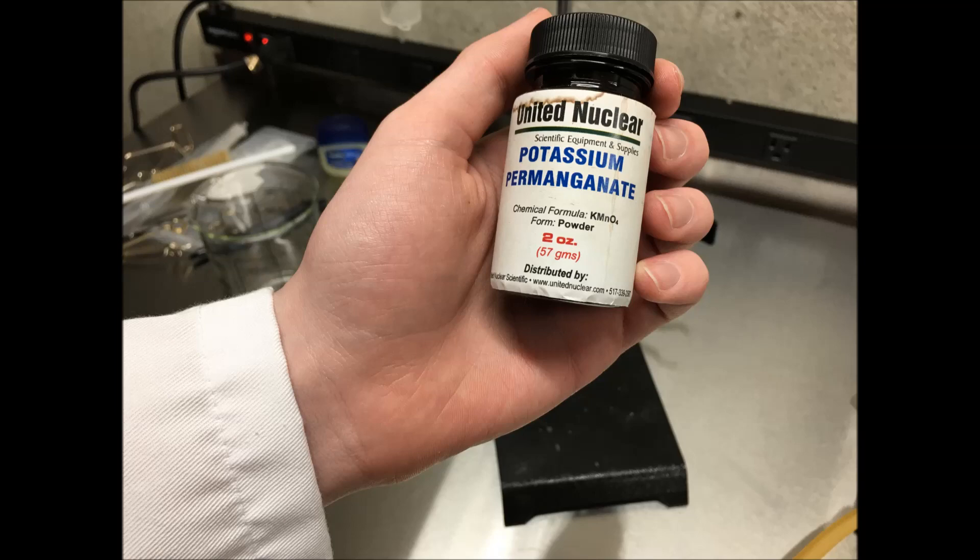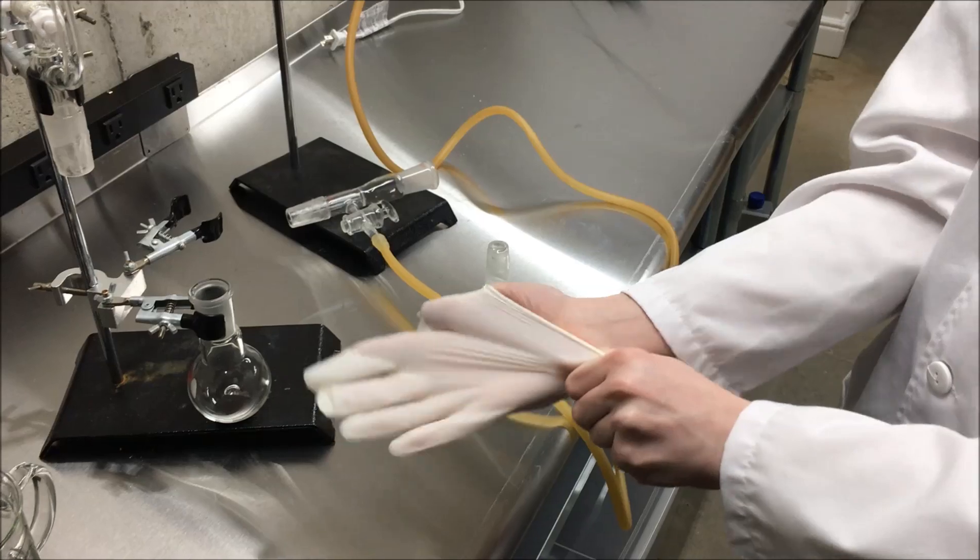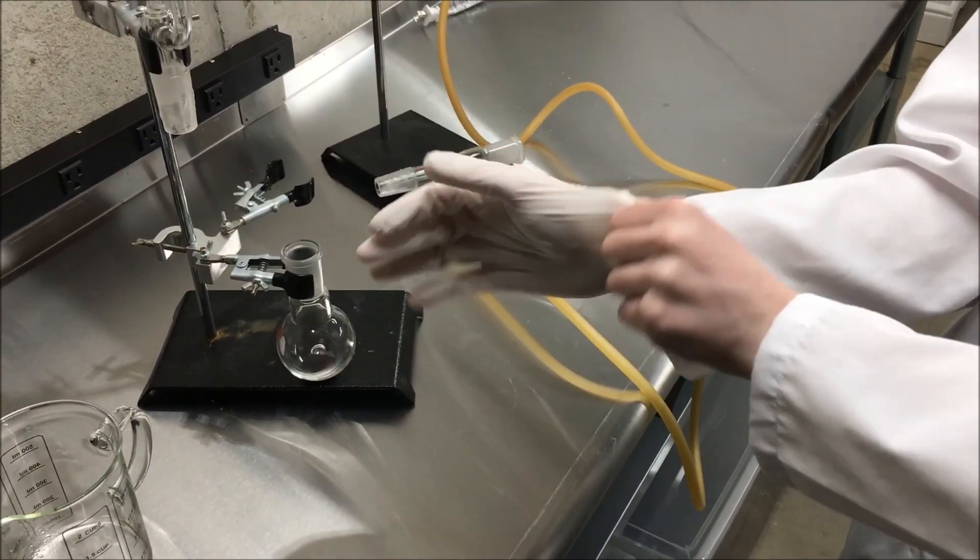This does deal with concentrated hydrogen peroxide, so be careful and wear gloves and safety goggles.